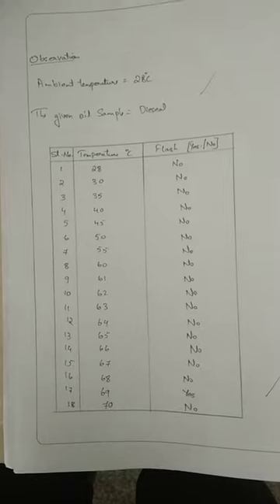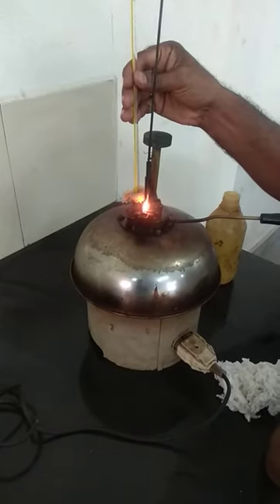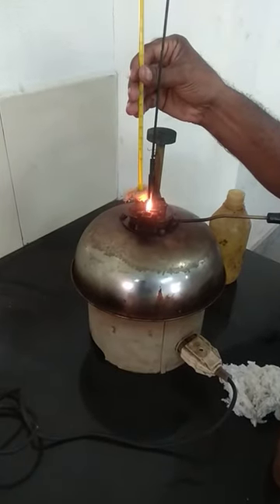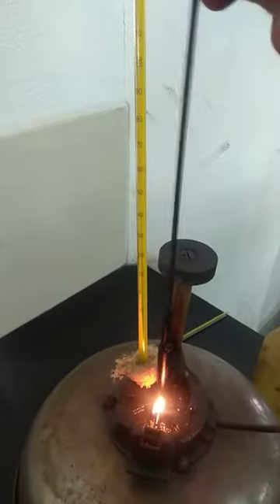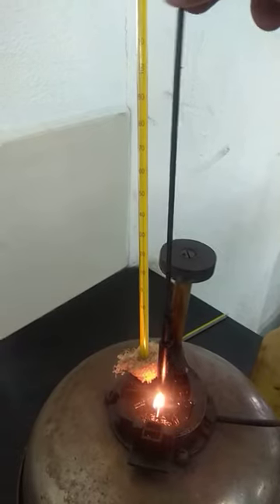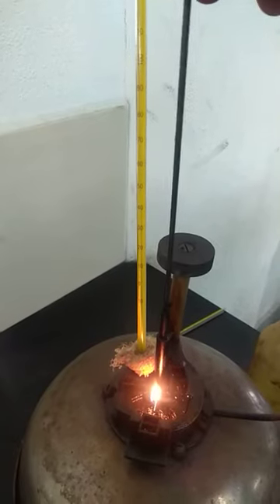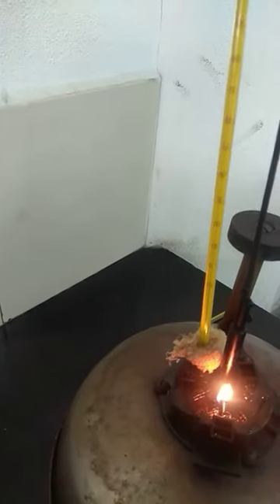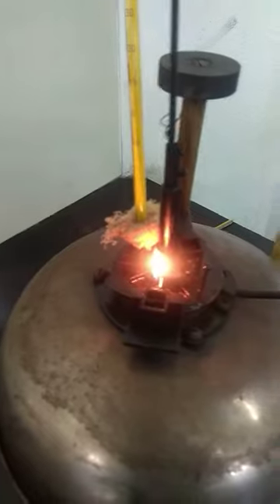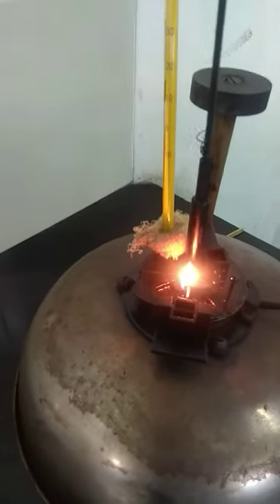You have the Pensky-Martens apparatus here — it is a closed cup. This is the stirrer; you have to keep stirring throughout the experiment. Through this opening we have placed the thermometer. You switch on the switch, then you light the lamp at this point, and keep stirring throughout the experiment.